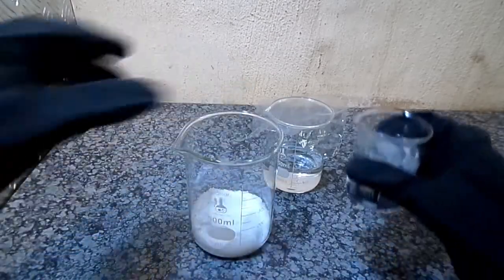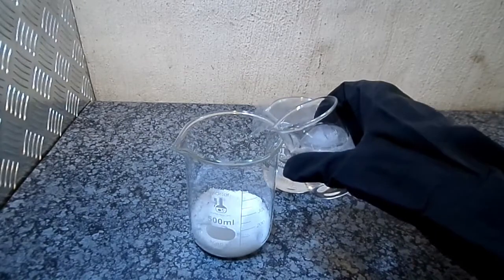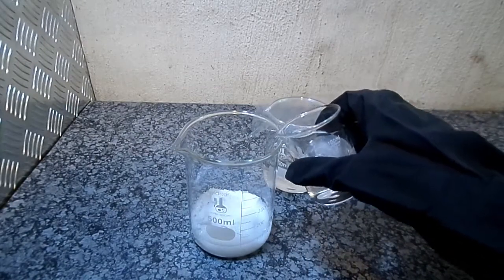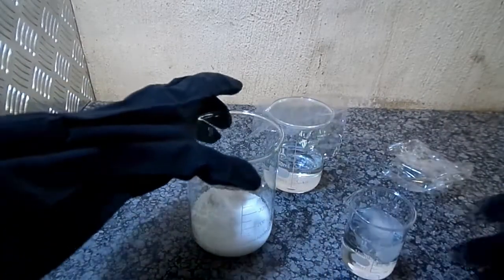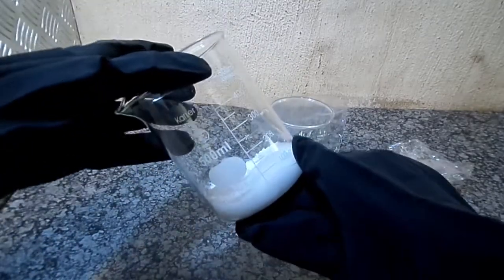To the sulfamic acid I added 100 milliliters of ice-cold water in order to help everything mix. The addition of water to the sulfamic acid did not generate any significant heat.